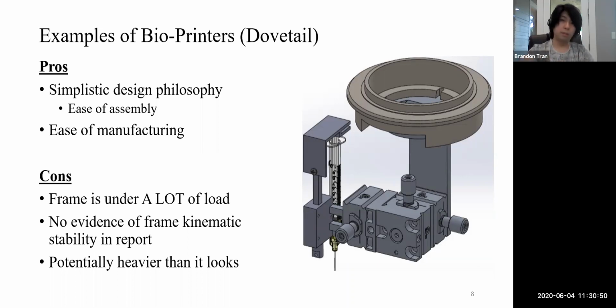This one's a little bit more unique because they're using a dovetail as their transition. As I talked about guide rails, but somebody decided they wanted to use dovetails instead, which is very simplistic philosophically because you have only a small linear transition with a lesser amount of rotations needed to get to different positions.